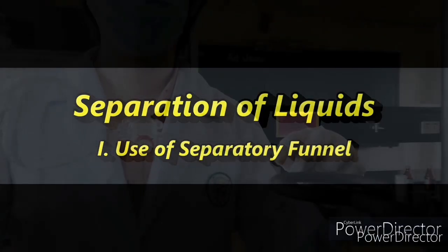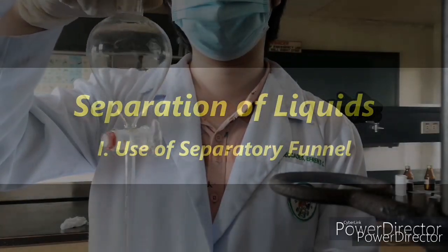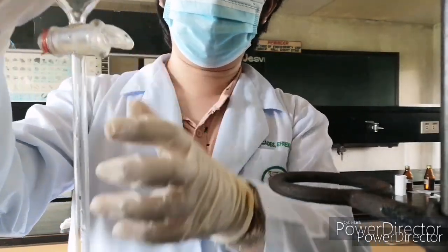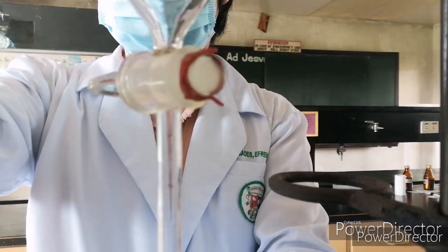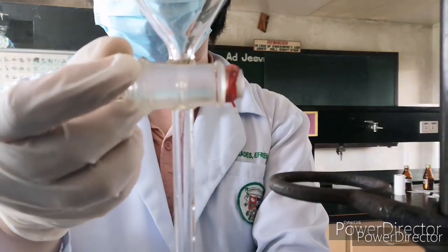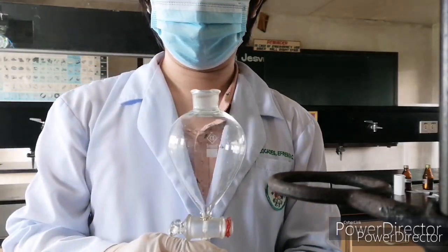Separation of liquids. Use of separatory funnel. I am holding here a separatory funnel that has a glass stopcock. As you can see, there is a hole in the middle, and once you place it vertically, you open the channel, and once you leave it horizontally, it is now closed.